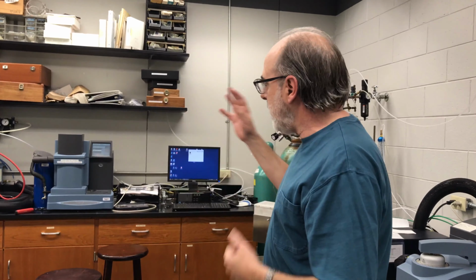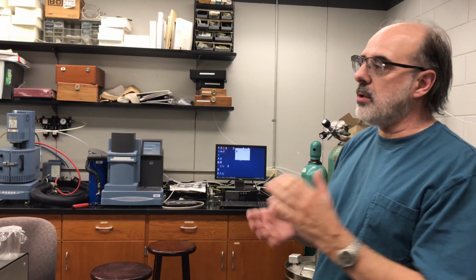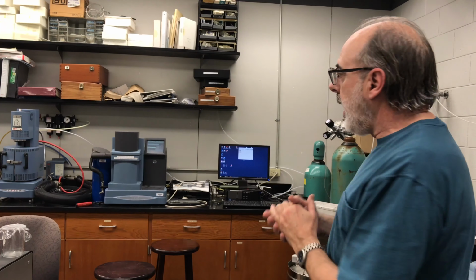So on this we are going to measure properties of polymers or particles. Depending on temperature, we can measure composition, decomposition, thermal events, glass transitions, crystallization, crystallinity, melting. DMA, we are going to measure modulus, in some cases glass transitions. Rheology, we are going to measure all kinds of rheological properties.